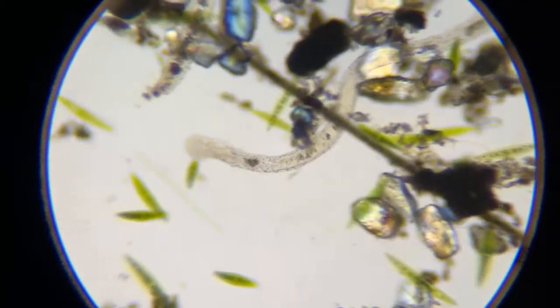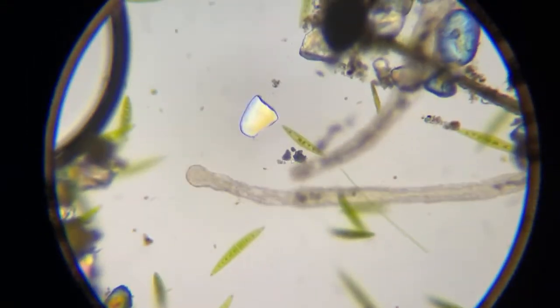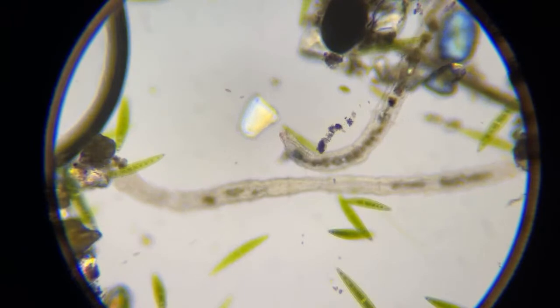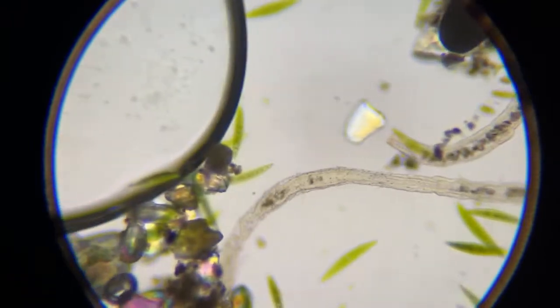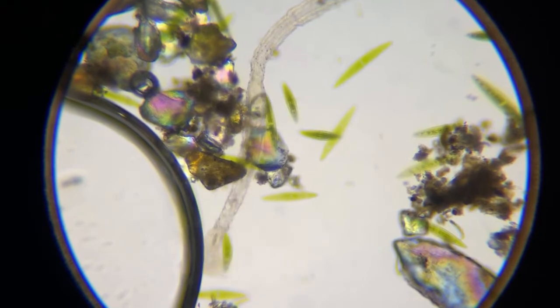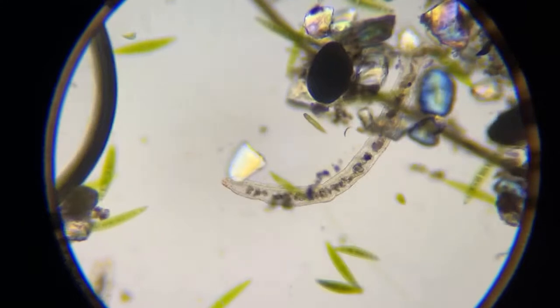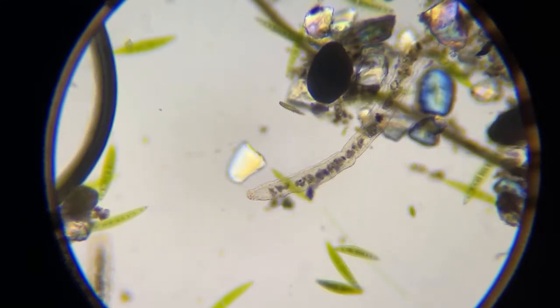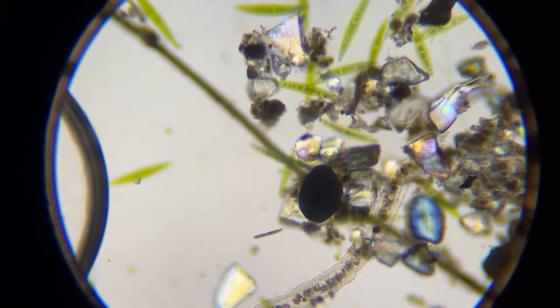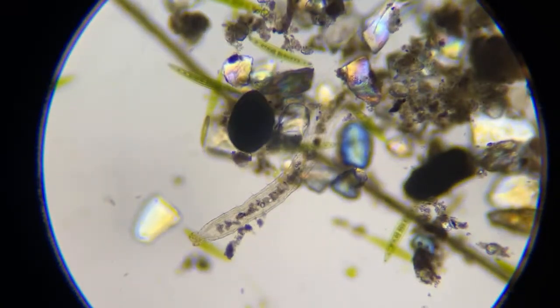Yeah, blood. I mean, I've never had anything from an octopus before. I don't even have any protists from the ocean. But yeah, you can look at different creatures' blood. I looked at my own blood. I used to think you can just get a little dab of blood, but you need a good pinprick to get some good blood on the screen. And I don't like to prick my finger.